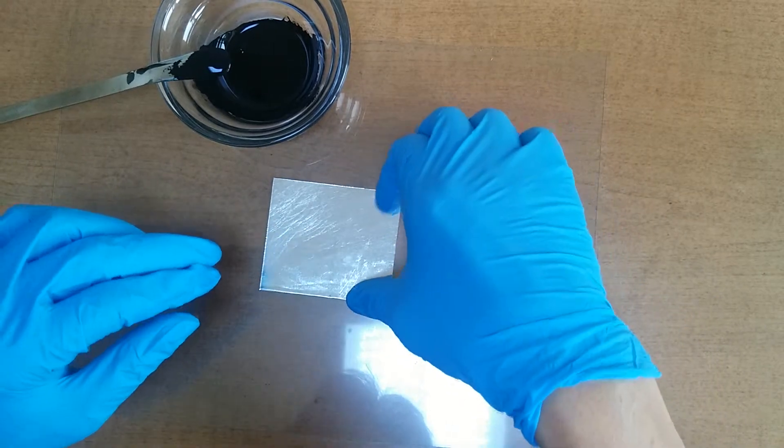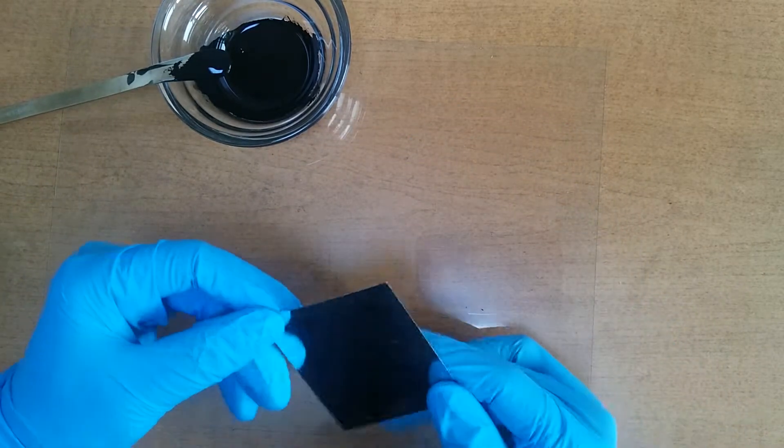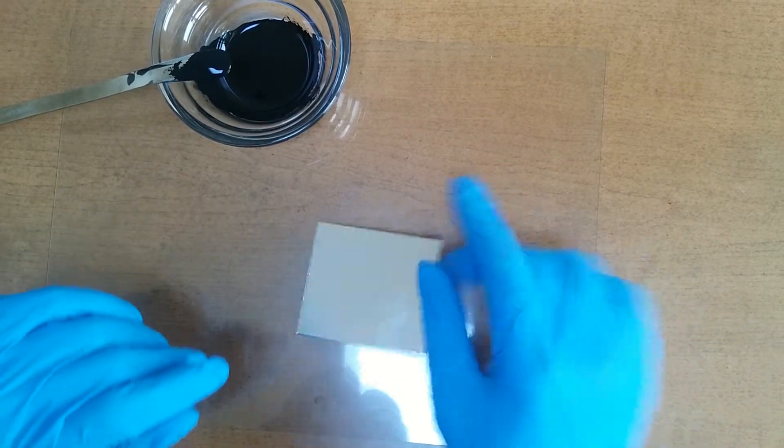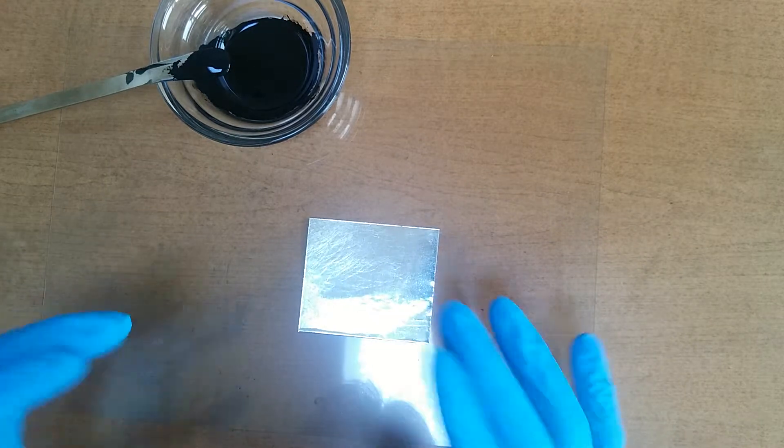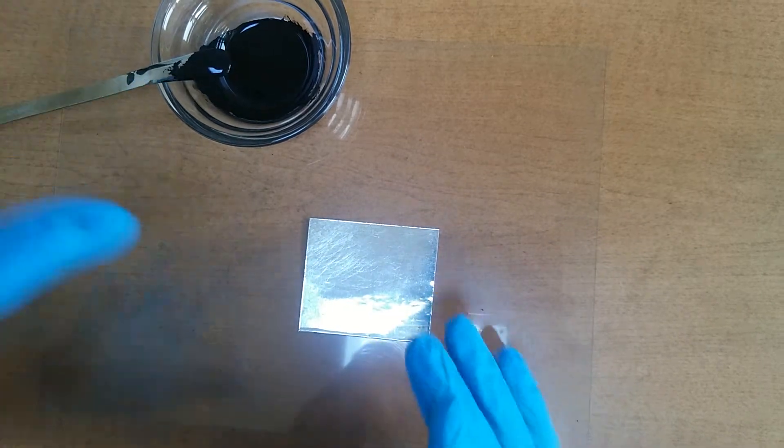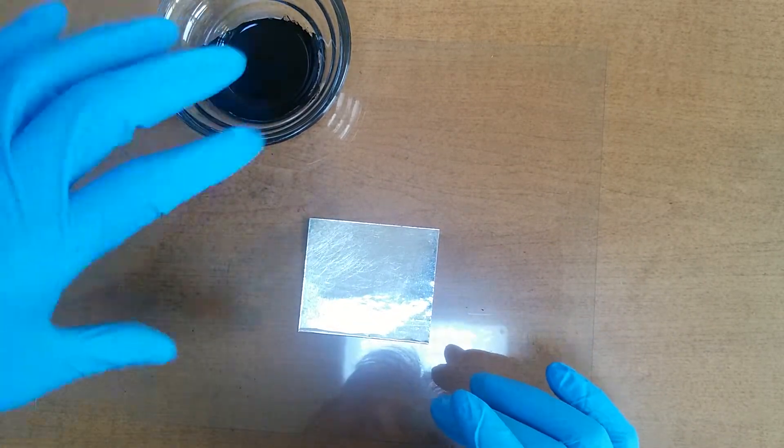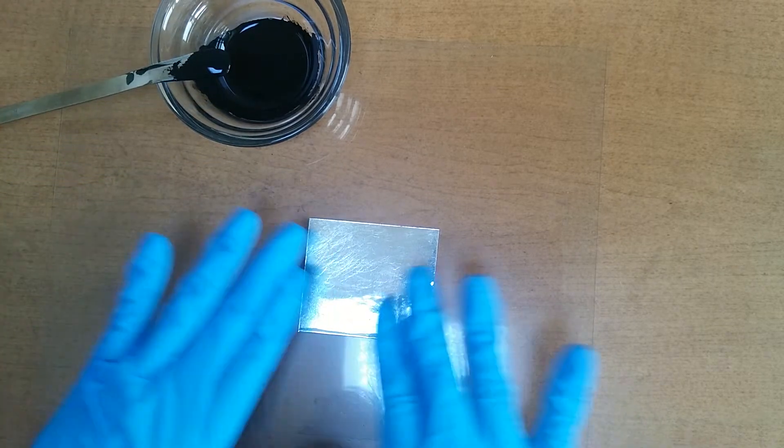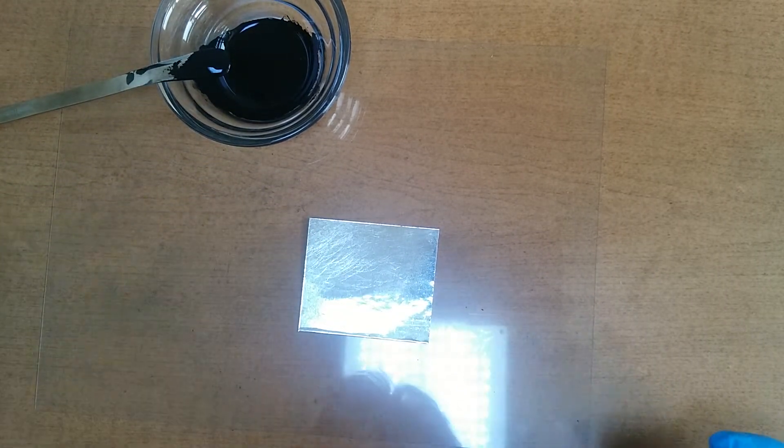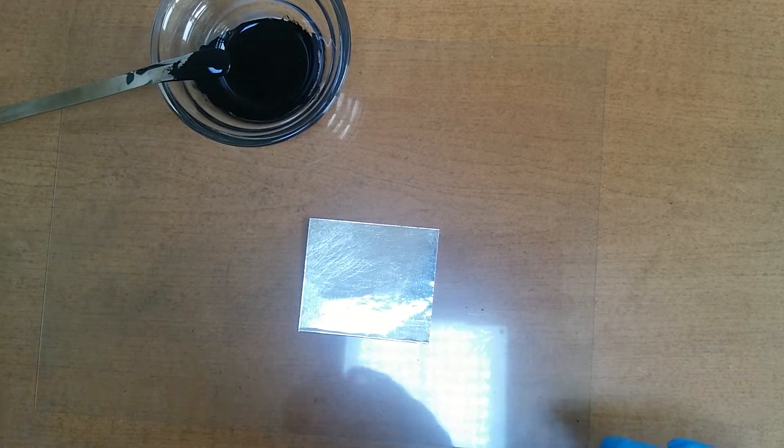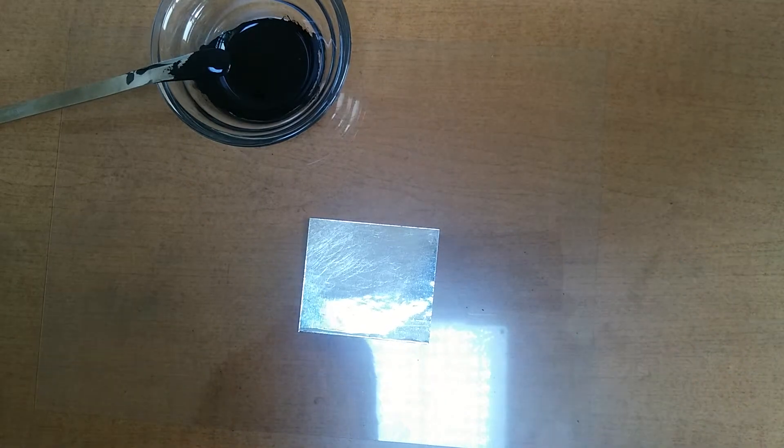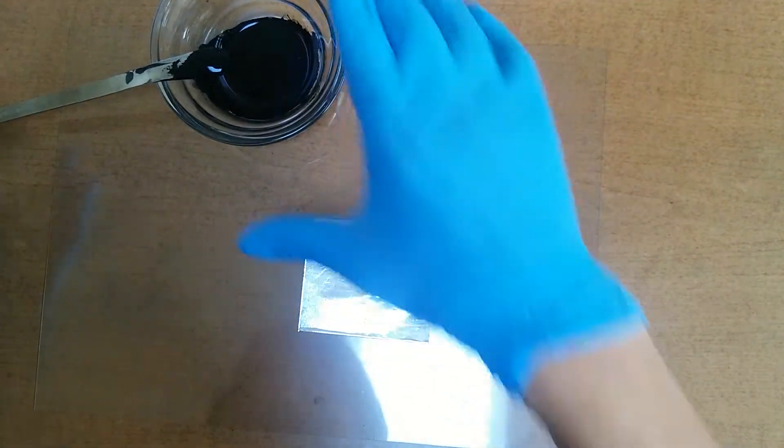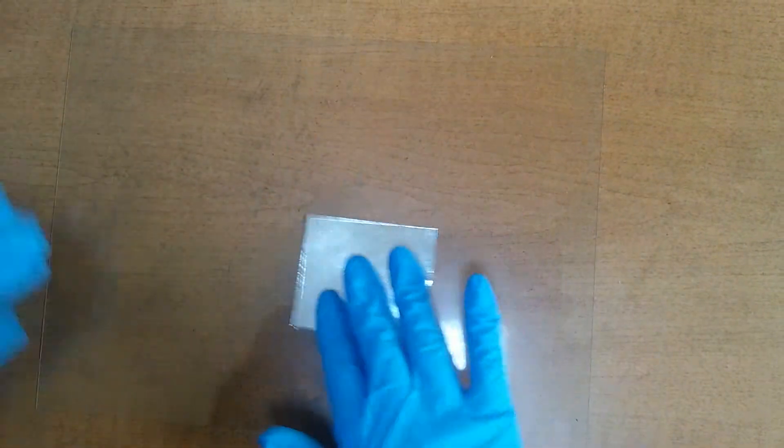Today, I am going to use this aluminum. After coating my graphite solution onto this aluminum plate, I will check about the ohm. By the way, let's check about the ohm of aluminum surface.